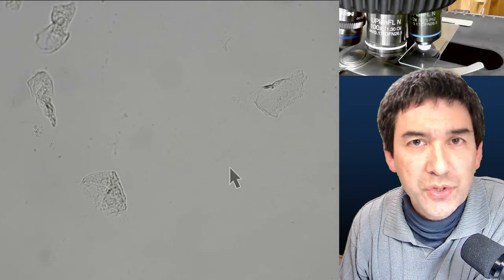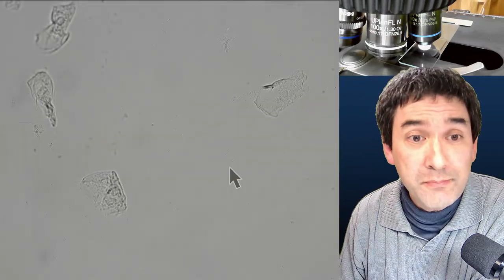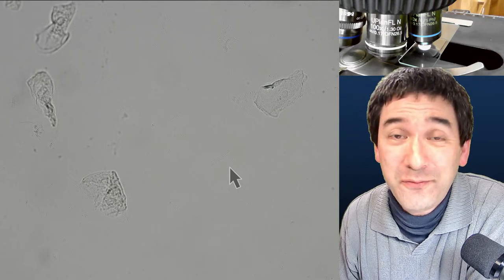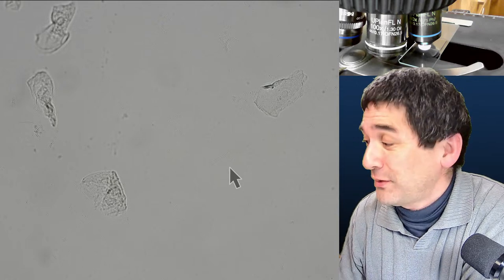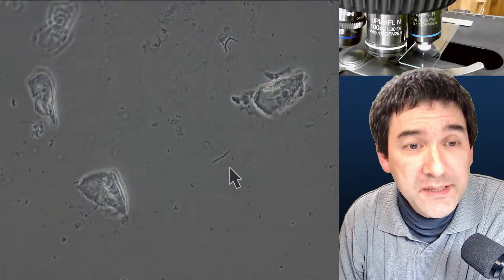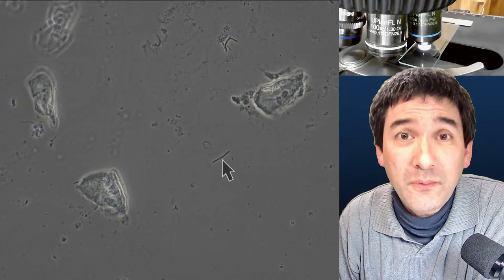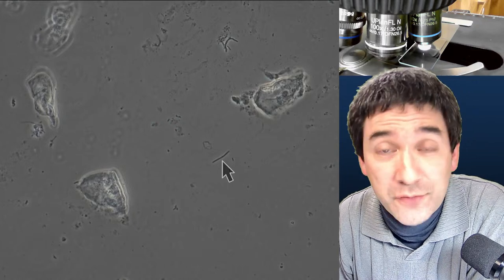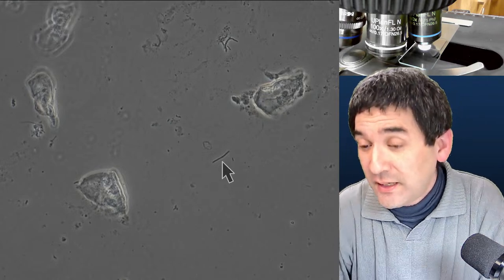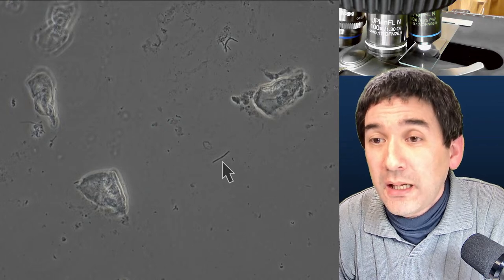Now let's see the bacteria in bright field: I close the condenser and lower the intensity — and we're barely able to see them at all. This demonstrates an important concept: many people think high magnification is all you need to see bacteria. But bacteria are so transparent that even at maximum contrast they're nearly invisible in bright field. Engaging phase contrast again — and immediately they reappear. So for quick bacterial counts without staining, phase contrast is the way to go.